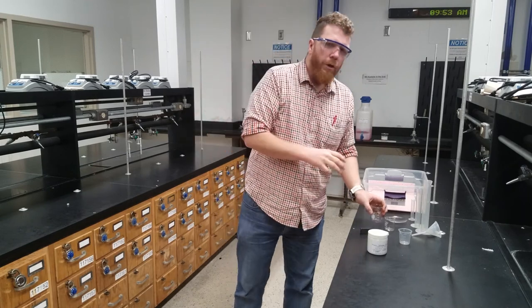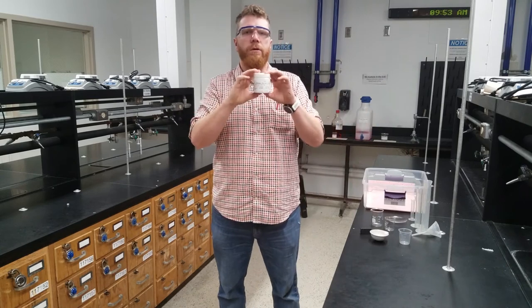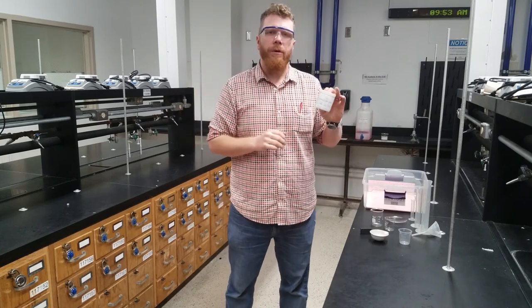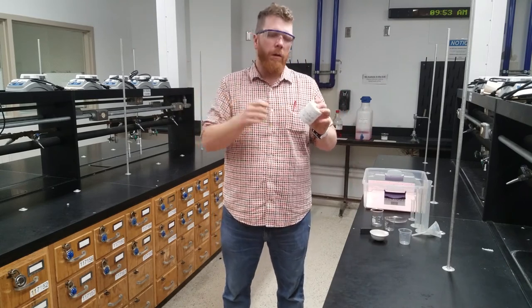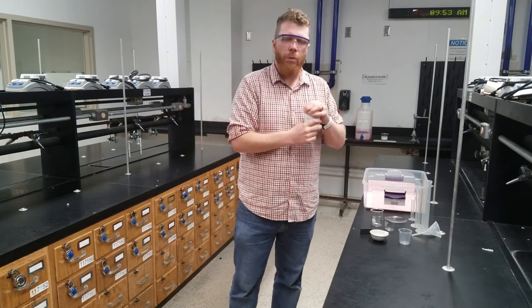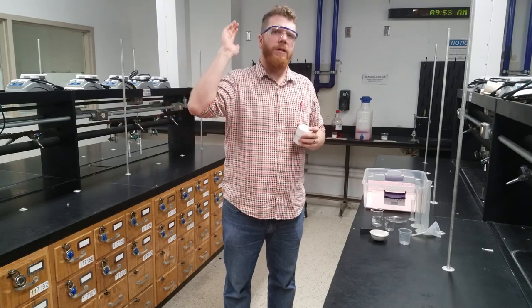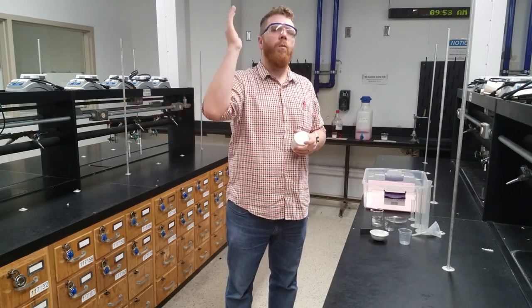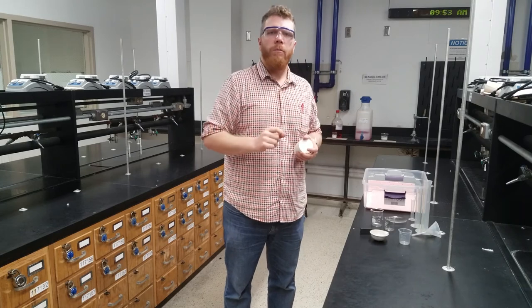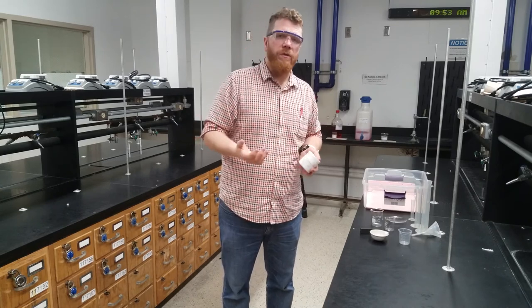When a calcium ion and a carbonate ion come in contact with one another, they form an insoluble calcium carbonate ionic compound. So you will separate these three components from this mixture, isolate each one of those components, and determine what percentage of the initial overall mass is calcium carbonate, what percentage is silicon dioxide, and what percentage is the small metal beads. By doing all this, you've learned about both chemical and physical separations.